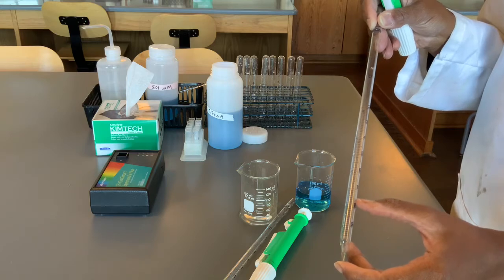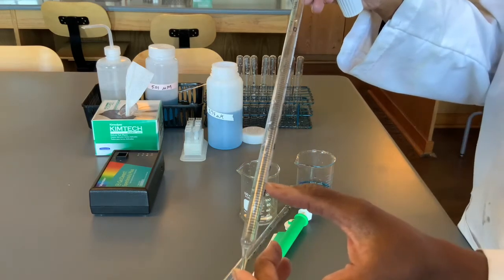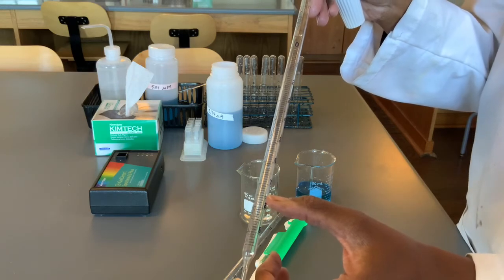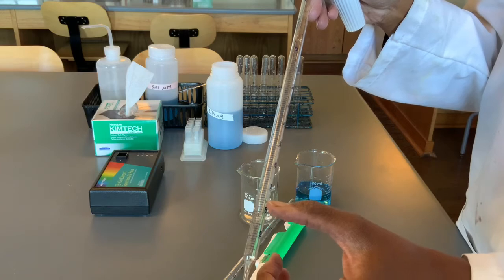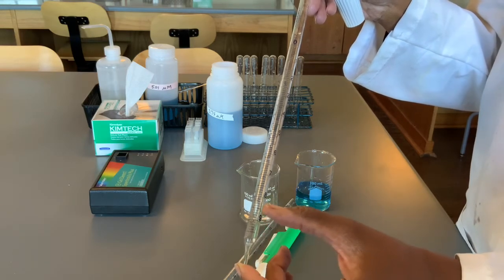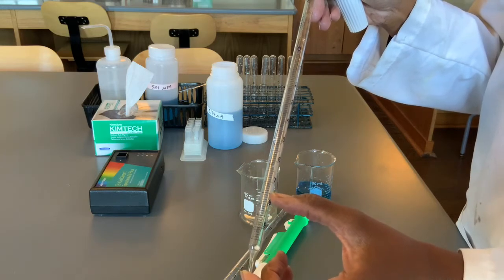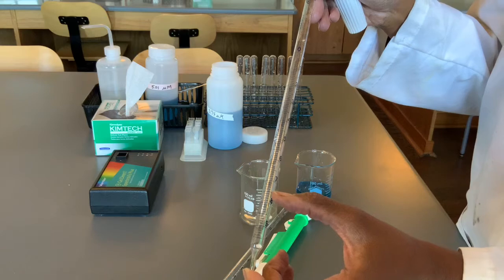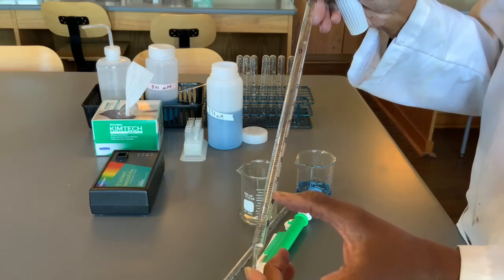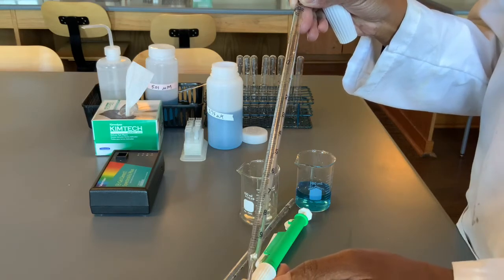If you pipette 2.5 milliliters, as you can see here, not only are you pipetting between the 7 and the 8 to the half point, but see how many significant figures you could read from this measurement instrument. 1, 2, 0.5 milliliters are clearly noted, and we'll have to estimate 1 additional digit, so that would be 2.50. 3 significant figures in milliliters can be read from this pipette.